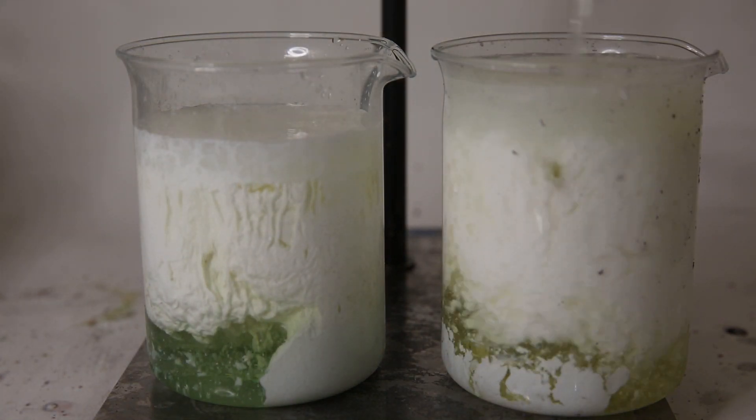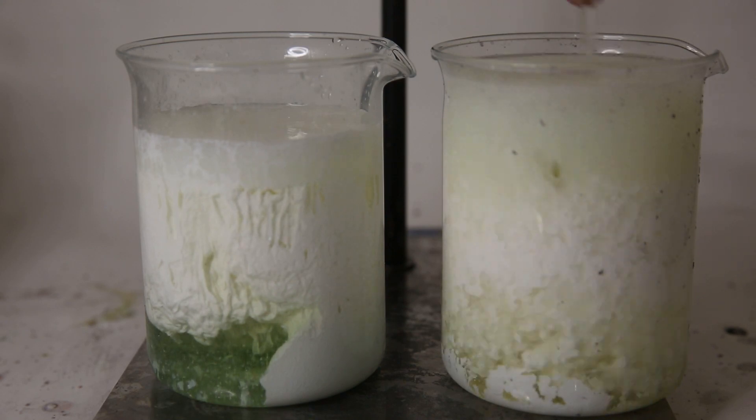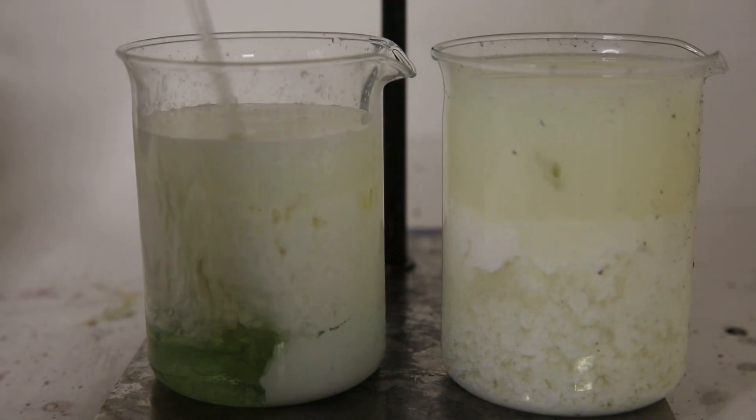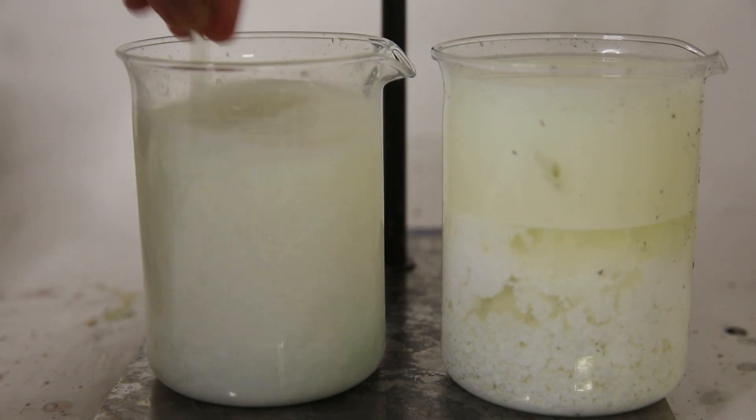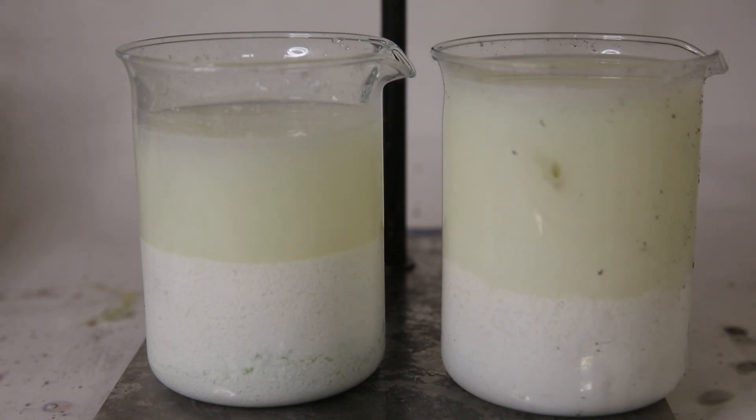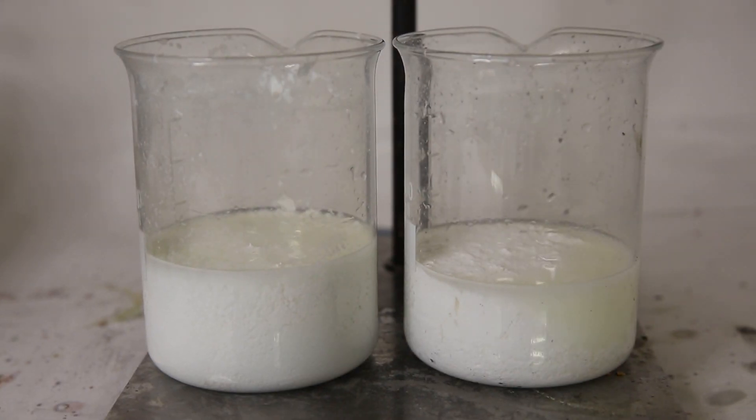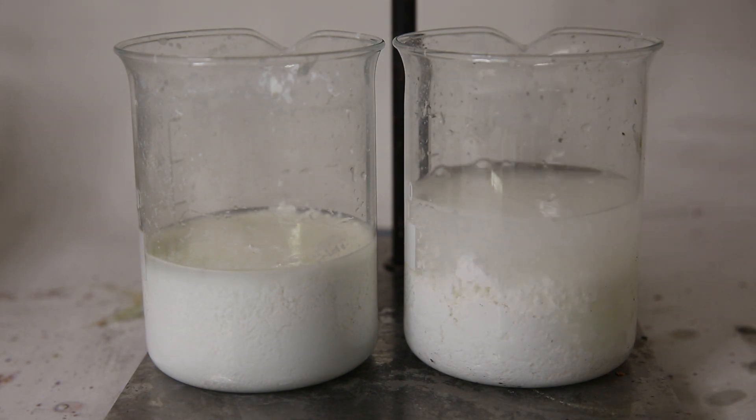To break apart the cloud of silver chloride, I can stir it around and allow it to settle. After it has settled, I can easily pour off the water remaining on top.